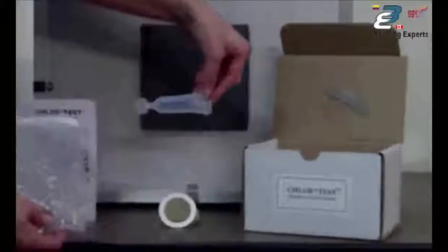To perform the individual test requires an adhesive sleeve and an ampoule of pre-measured extract and the glass titrator tube, which actually measures the chlorides in parts per million.